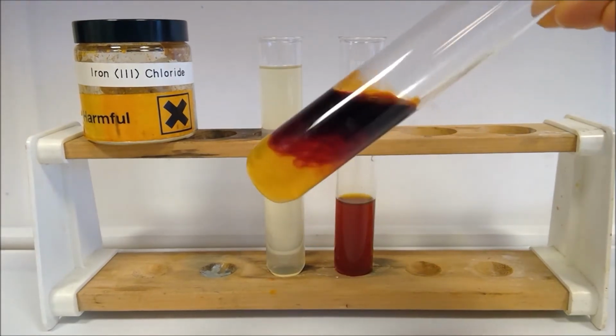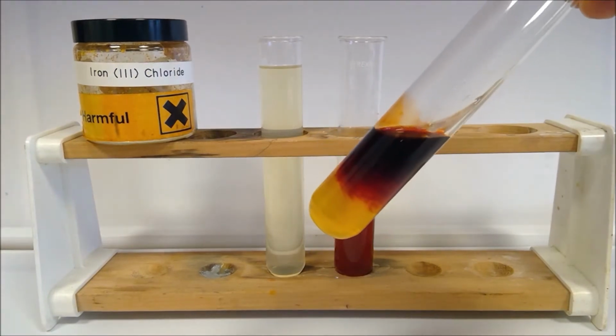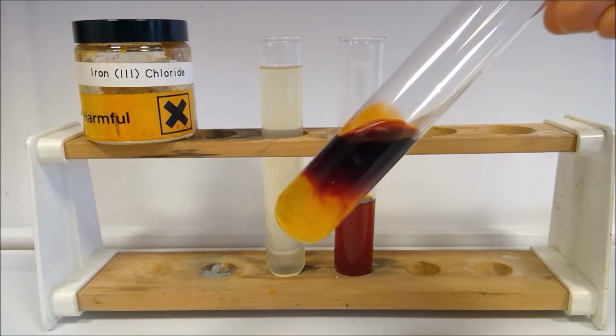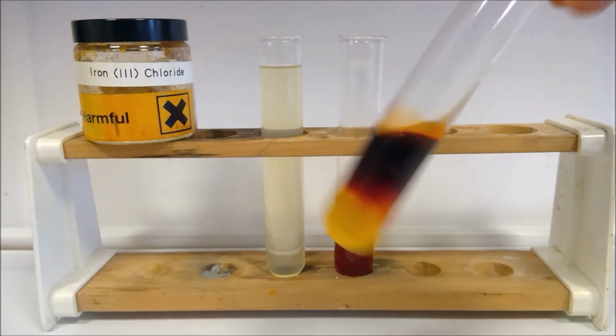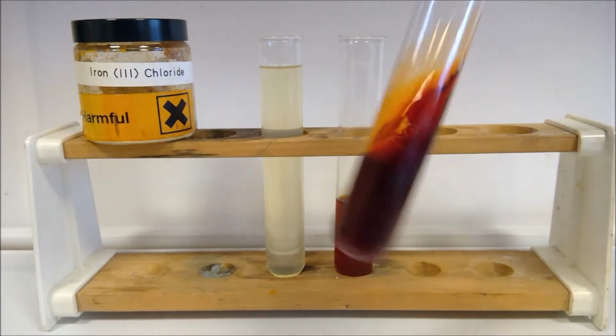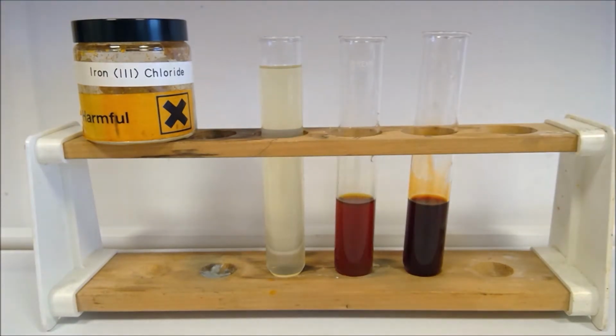Okay, this is quite cool. Thiocyanate can be used to identify the presence of iron 3, and we say it forms a blood red solution that's only at the interface there. You can really see. I'll give it a bit of a shake up there. There was supposed to be no more clues, never mind. Okay, so that's your iron 3.